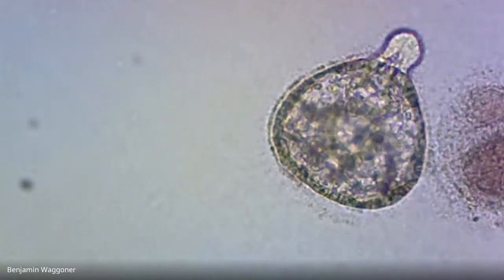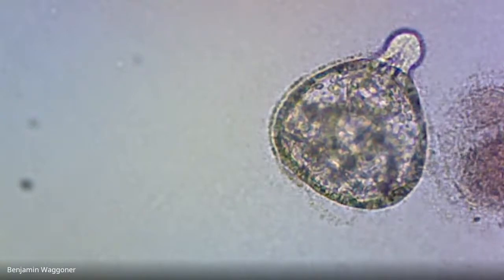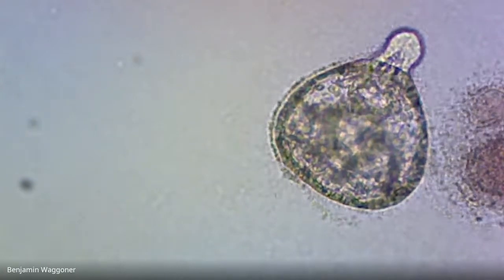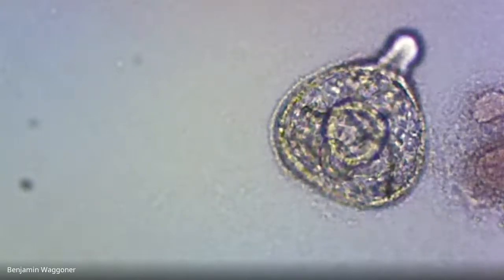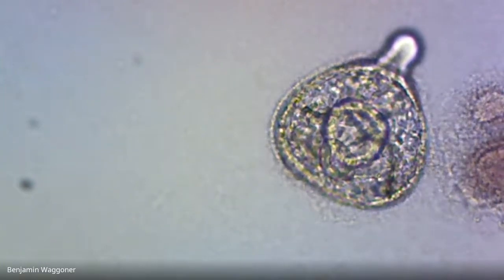And yeah, I think the reason it's got that funky shape may be that it's trying to get out of its membrane. Which means that we can probably get away with calling this a prism larva, even if I can't quite see the full shape. So there. So we got that much.